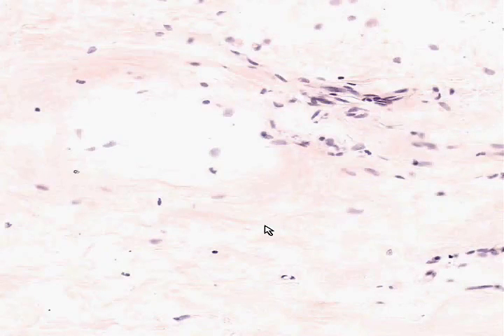In addition, if the density of collagen fibers in a connective tissue is definitely one-dimensional or linear or all lined up, like parallel bands, that would be what we call regular connective tissue, in which the stress put on it is basically in one direction, for example, a tendon. When you see collagen fibers which seem to go every which way, that's what we call irregular connective tissue.